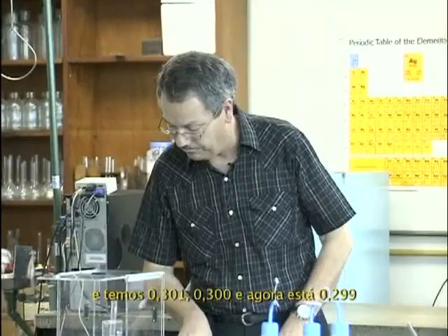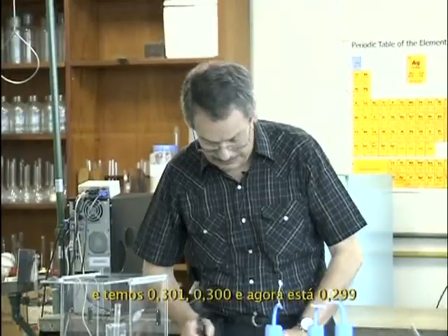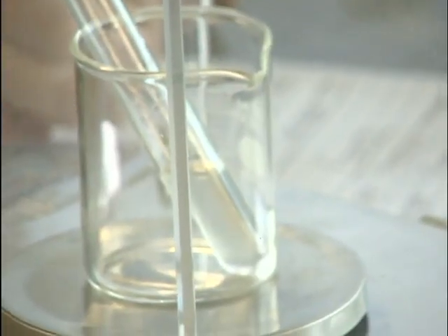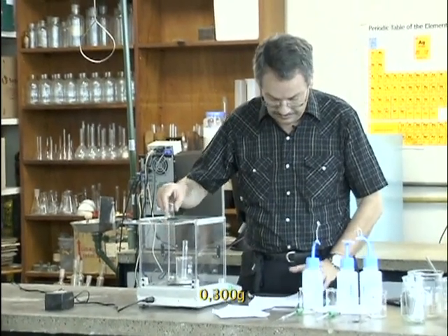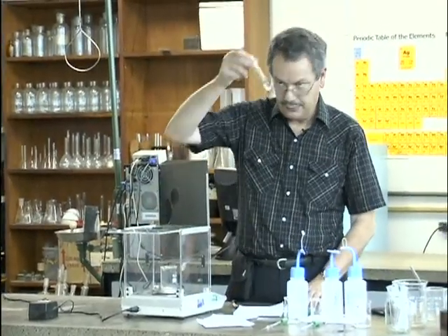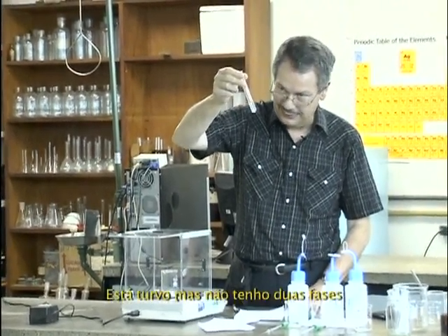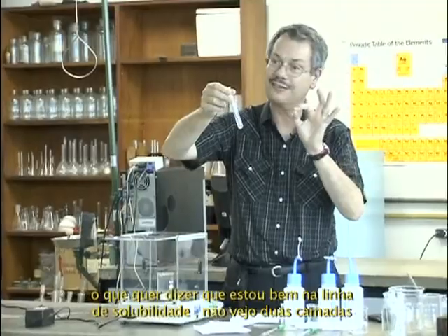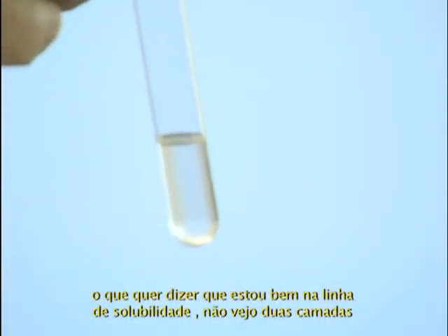So this is 0.301, 0.300, and now it's 0.299, 0.300 gram. 0.300 gram. You see, it's cloudy, and I don't have 2 phases, which means I am really just on the binodal curve. I don't see 2 layers.